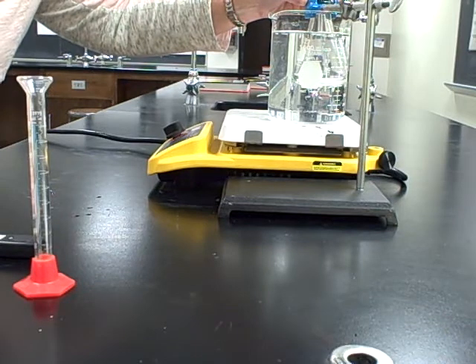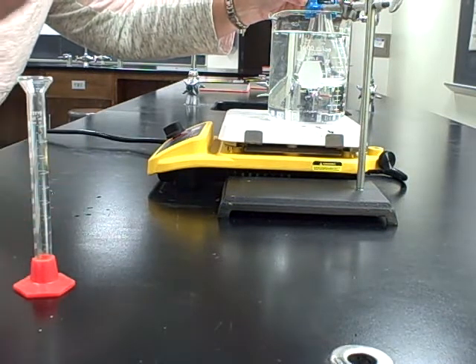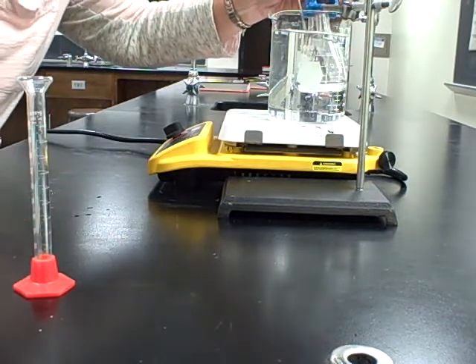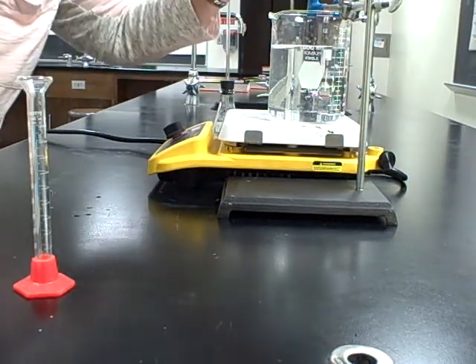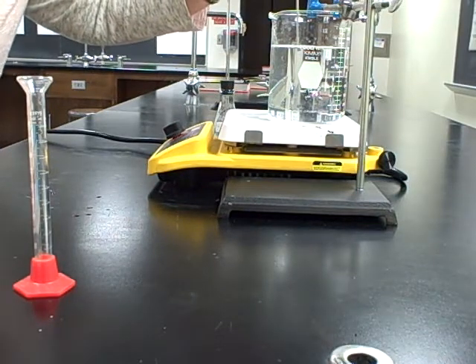Step eight says measure the temperature of the water by placing the bulb of the thermometer on a level with the center. I can go ahead and take this out. Go ahead and measure your temperature. It should be around 95 to 100.